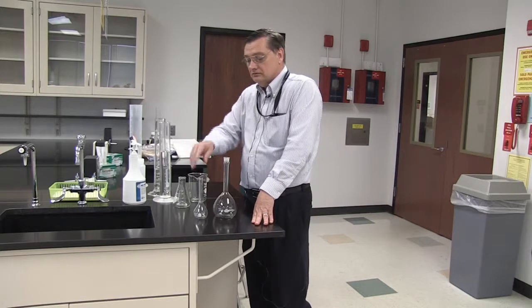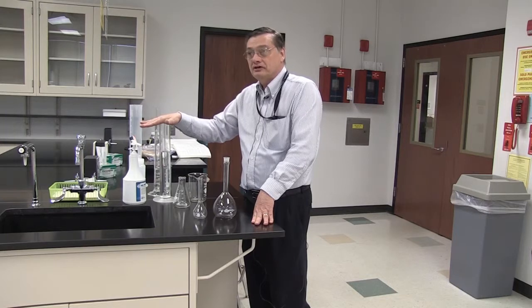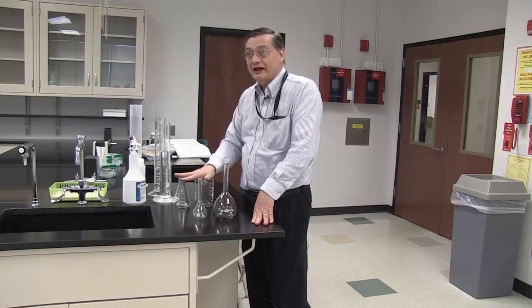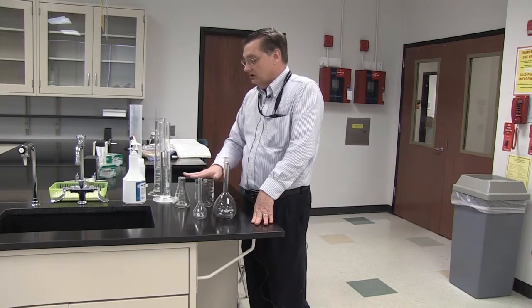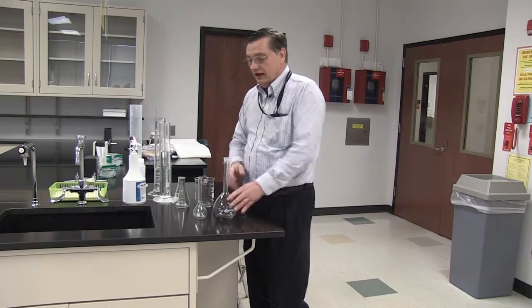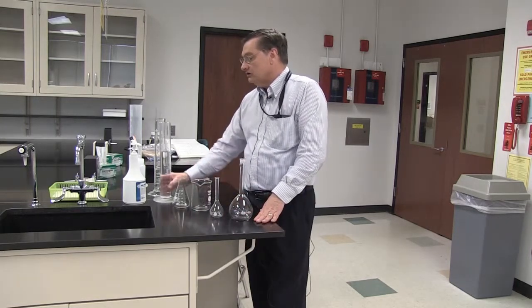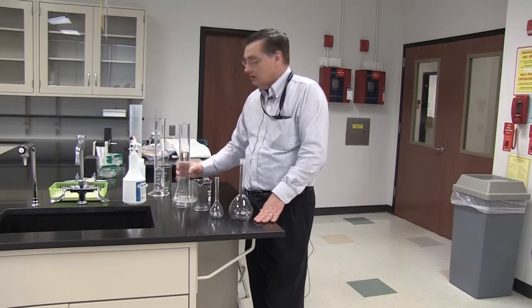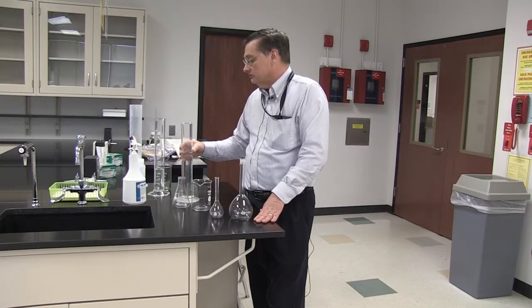So really, the point of this discussion has been to use the appropriate measuring device when you're preparing solutions. Beakers and flasks are very useful for mixing and handling liquids, but they're not the appropriate container for doing accurate measurements. Like I say, for high precision, standard volumes, volumetric flasks are nice. For routine lab use across a broad range of volumes, the graduated cylinder is the vessel of choice.